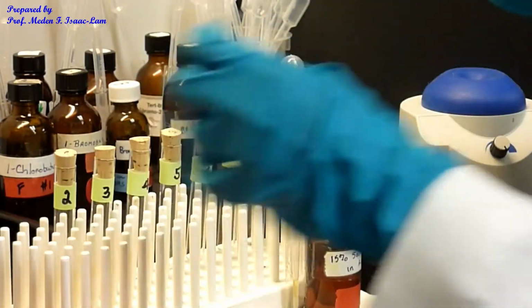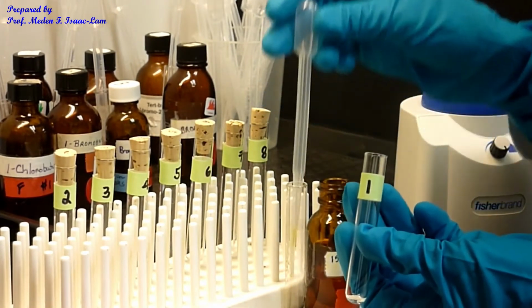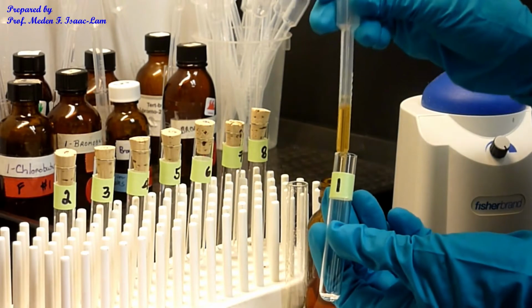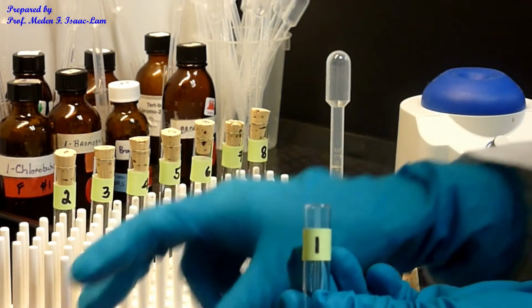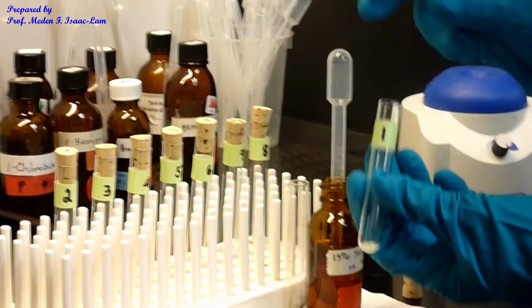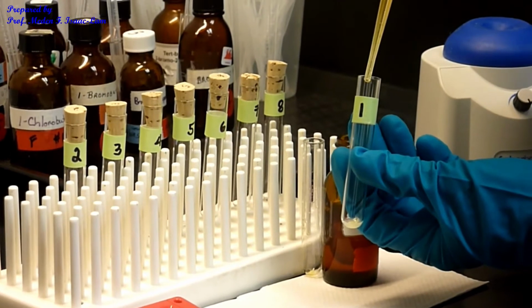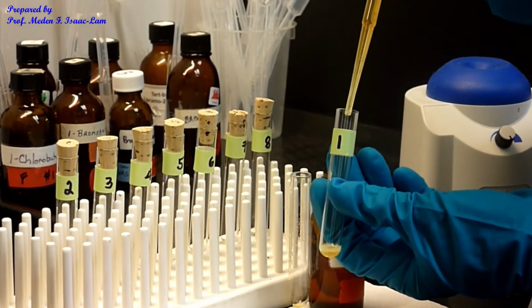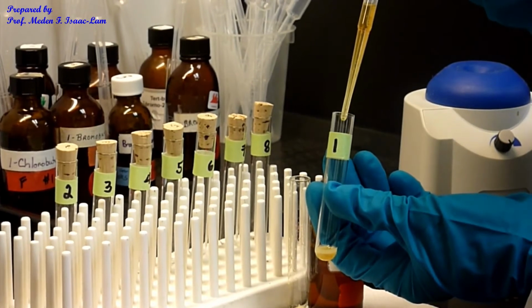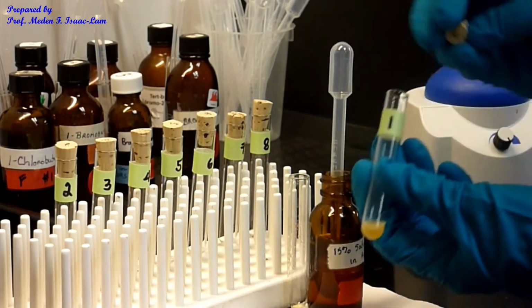Okay, so first sample 1. Okay, so I'm going to add 19 drops more, and then I vortex it.